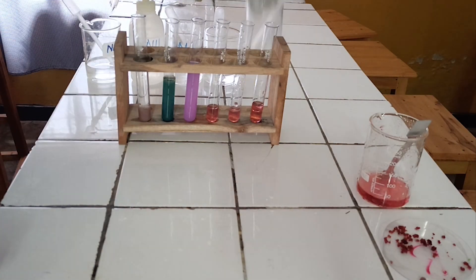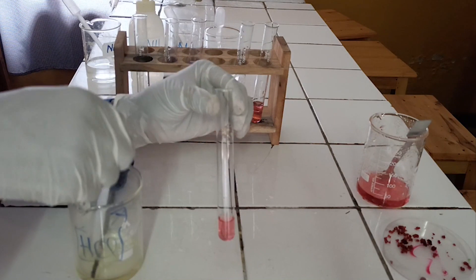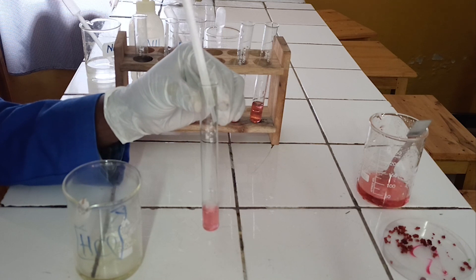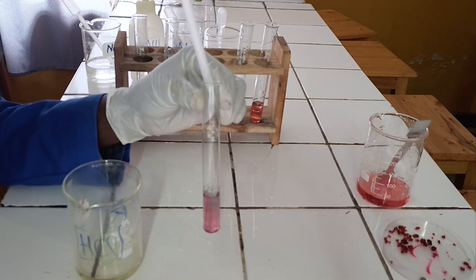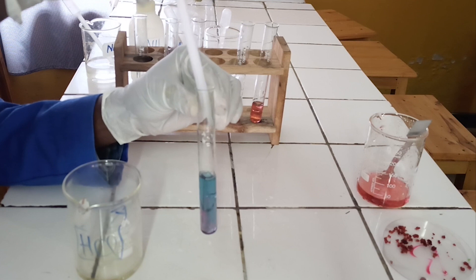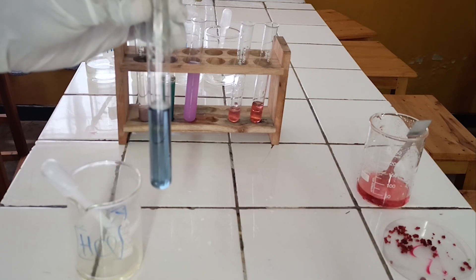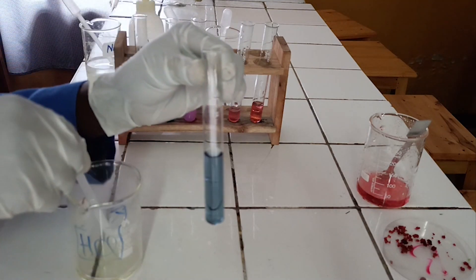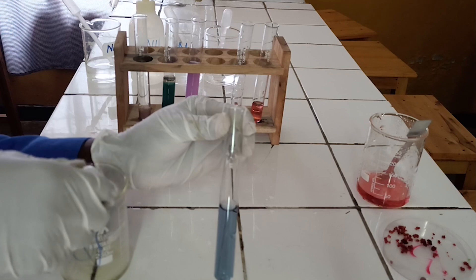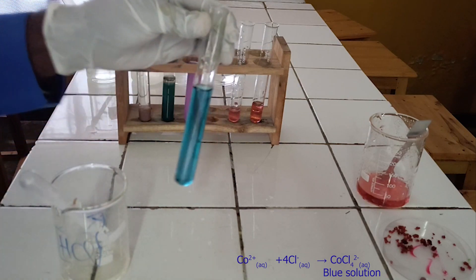Confirmatory tests. First confirmatory test: to the fourth test tube, add excess of concentrated hydrochloric acid. As you see, concentrated hydrochloric acid reacts with cobalt-2 ion to form a blue solution. Below there is the ionic equation for this reaction.